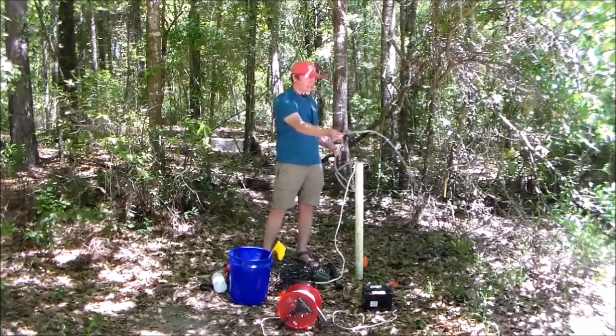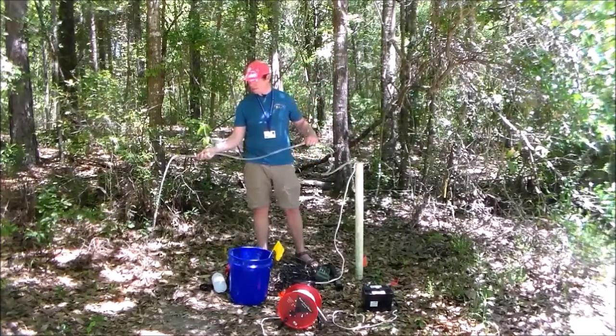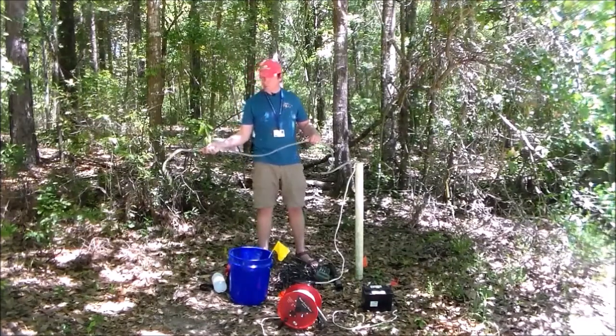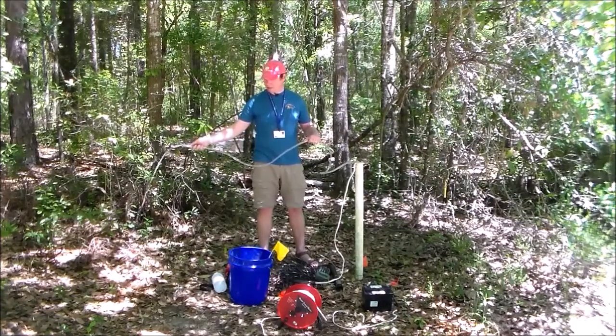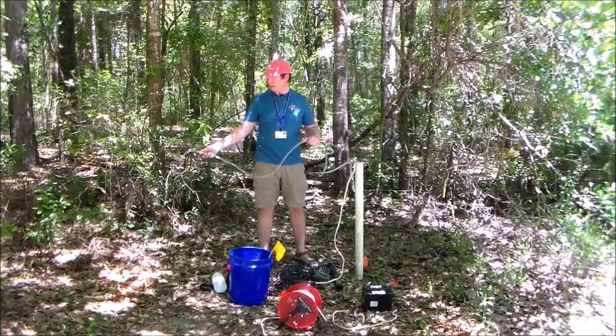If I had to guess, this is maybe somewhere around, I don't know, maybe 2-3 gallons per minute. So just to be on the safe side, I'm gonna let this run for about 10 minutes. And then I'll know that I've purged for sure. Usually I'd have some way of measuring that volume, but you know what, I'm okay just to let it run for quite some time and be safe with it.